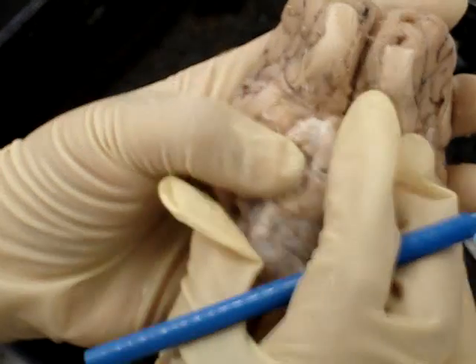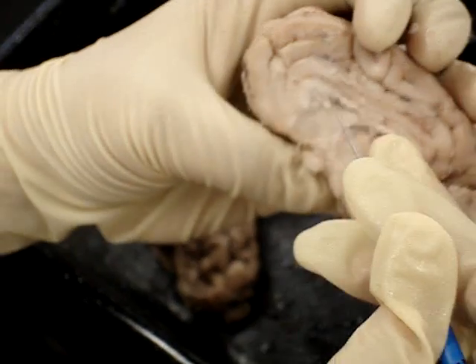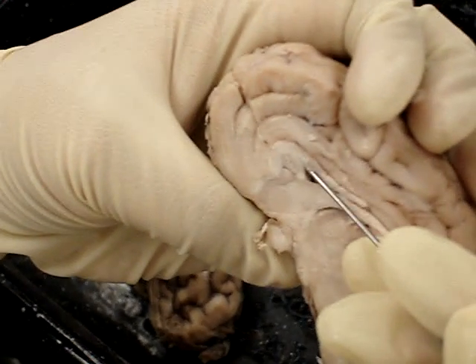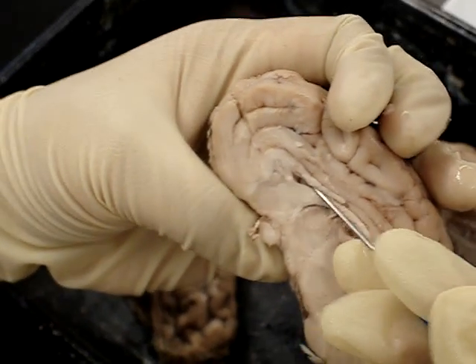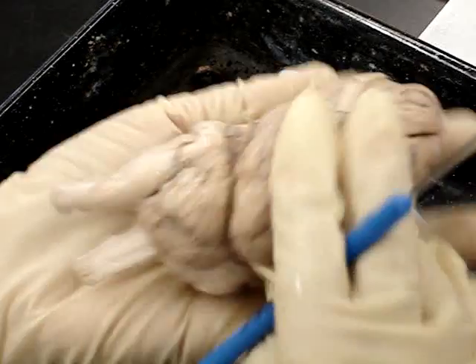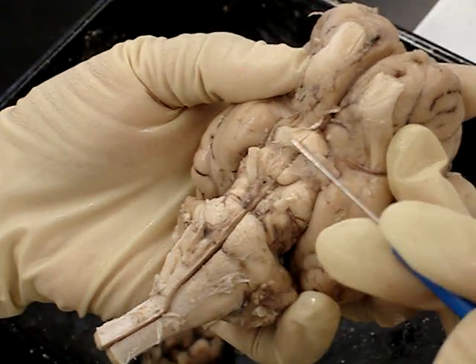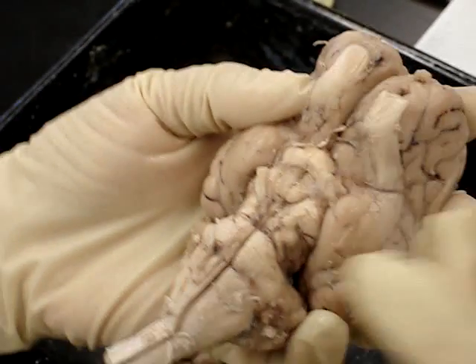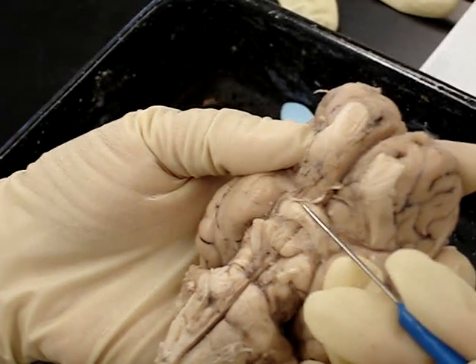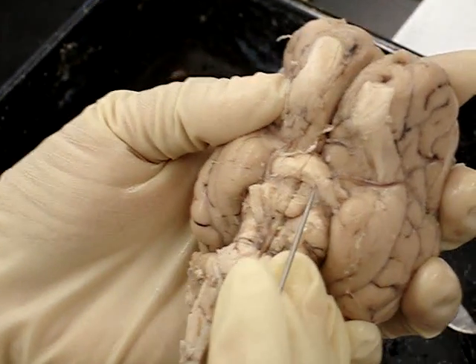The septum pellucidum is this membrane — it separates the lateral ventricles into the left and right lateral ventricles. The optic chiasm is where the optic nerves cross together, because there's one here and one here, and where they cross is the optic chiasm. After that is the optic tract — so these are the optic tracts.